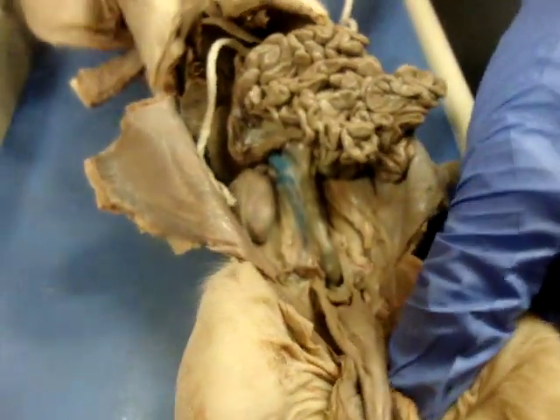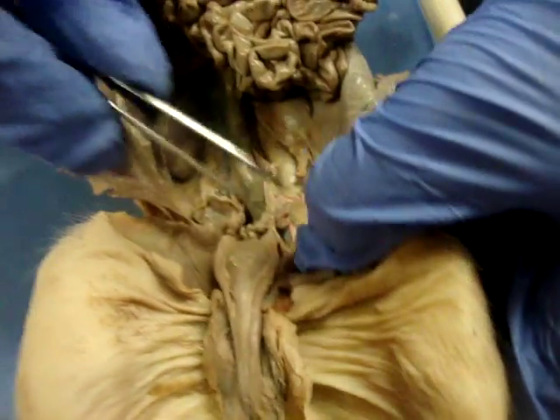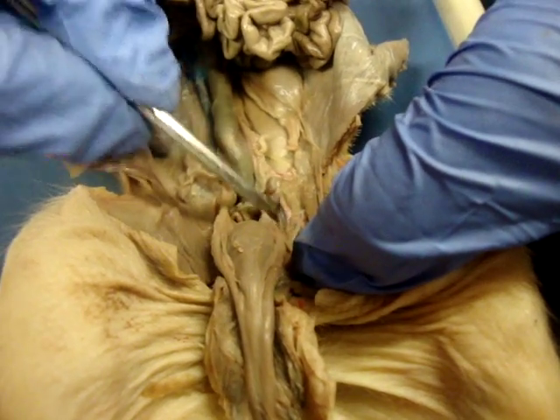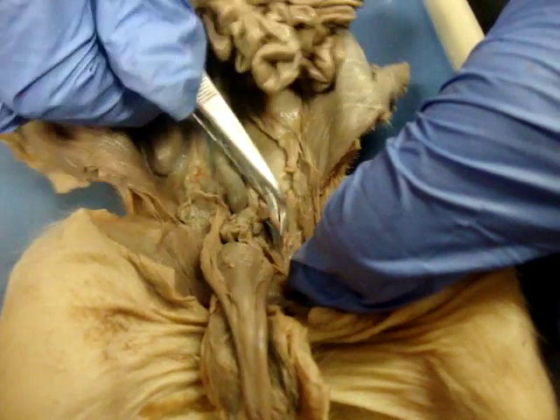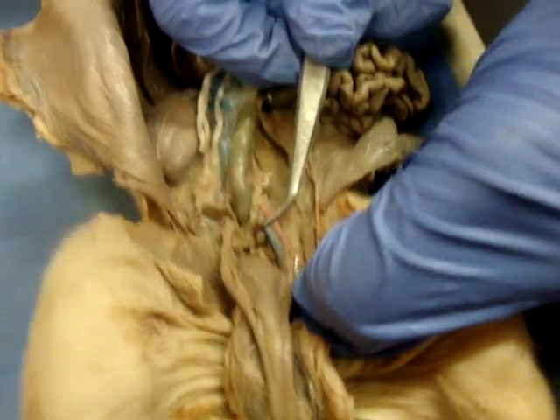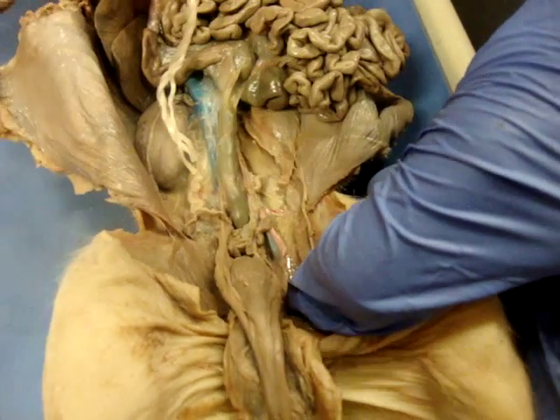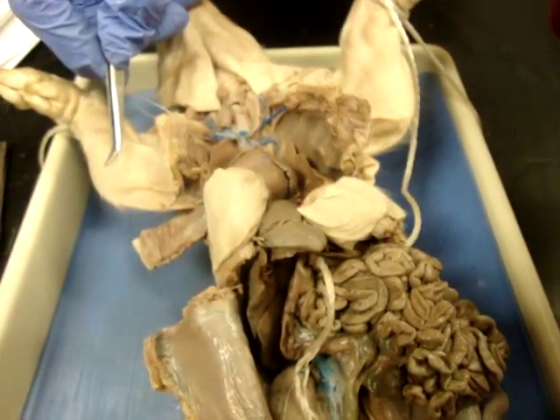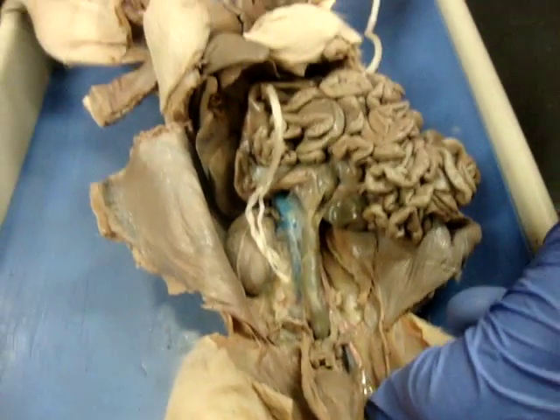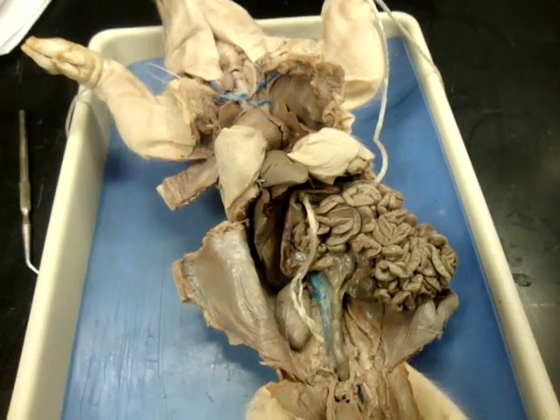Other things we want to find are the iliacs. Here's our iliac — you have your iliac artery and your iliac vein, and these are heading to the legs. Your best bet is to group things together: if it's going to the legs, it's iliac; if it's going to the arms, it's subclavian; if it's going to the kidneys, it's renal; and your jugular and carotid are in the neck region. Lump them together and it's going to help you really get to know these well.